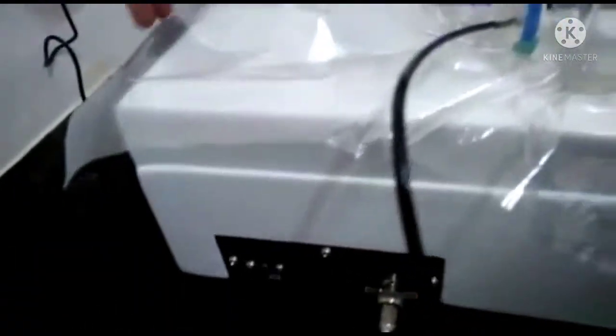First we have to make all the connections. Here we have to connect our electrode, this is a power connector.